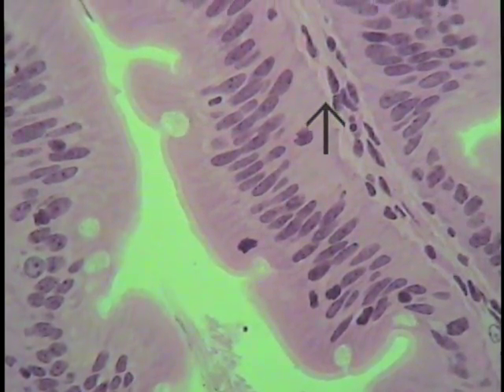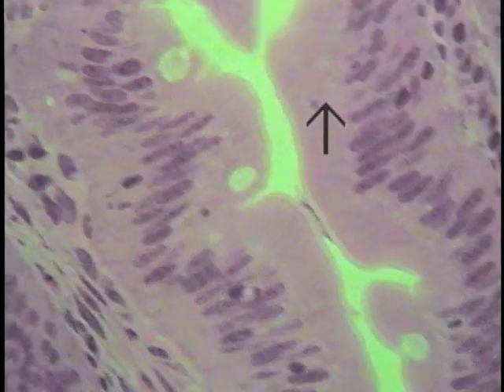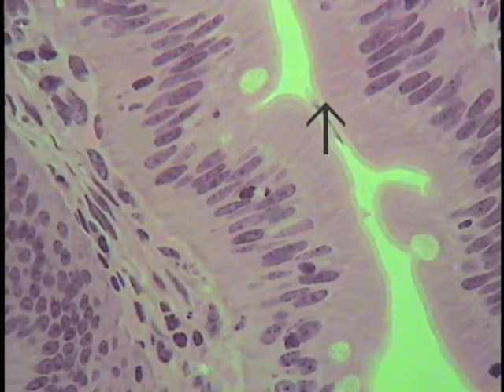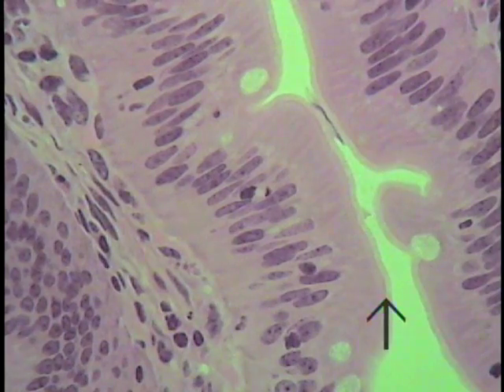So this is a simple columnar lining epithelium lining the entire intestinal tract. This type of epithelium will be found throughout its extent, both the large and small bowel. It'll be characterized by goblet cells, and typically, to increase its absorptive capacity, this intense microvillous border, oftentimes referred to as the striated border.